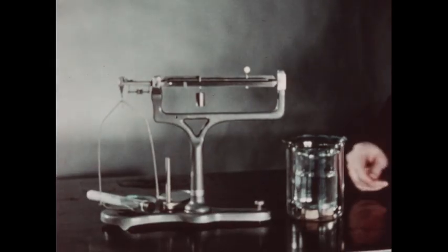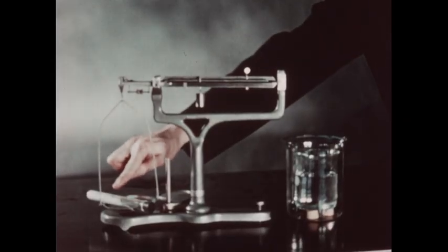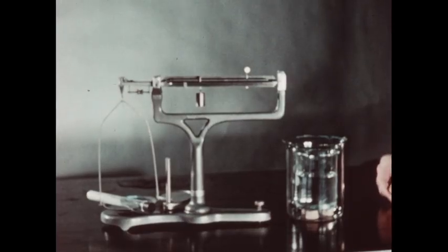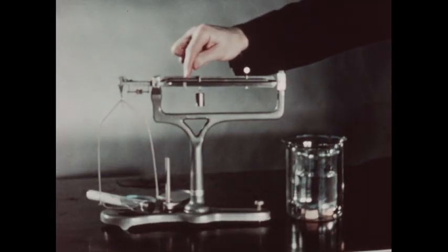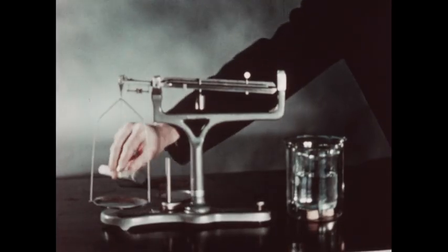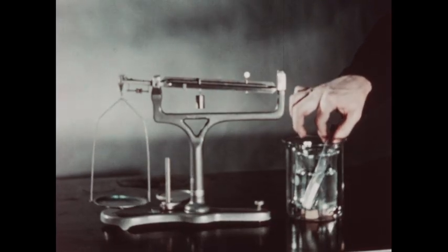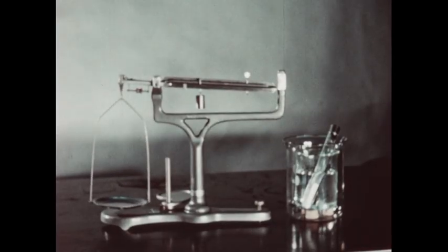Approximately 12 grams of anhydrous zinc sulfate has been added to this test tube, and the tube and its contents and the stopper carefully weighed. The weight of the tube and contents is 38.12 grams. We will now place the tube and its contents in the water, in the small beaker, in the calorimeter. This is done in order to bring the zinc sulfate to the same temperature as the water. We will now allow this setup to stand for about 15 minutes.